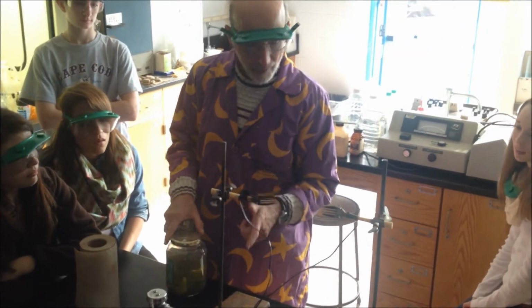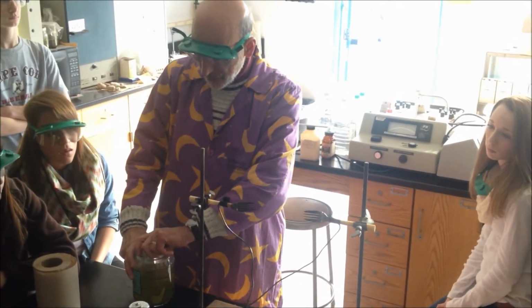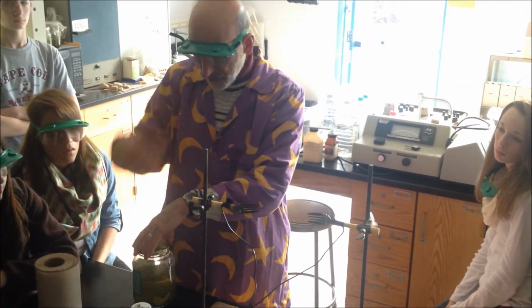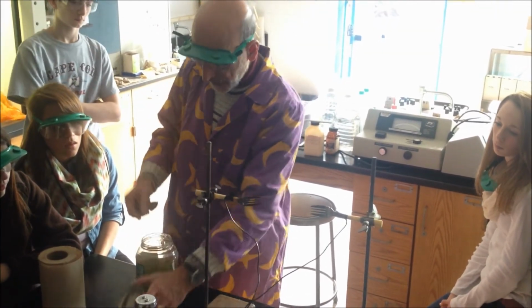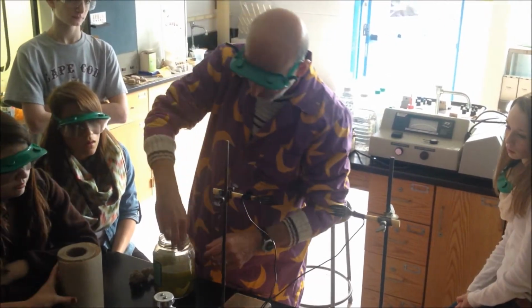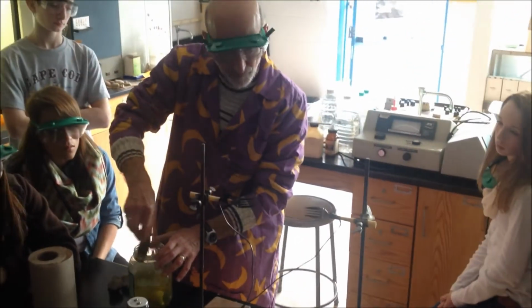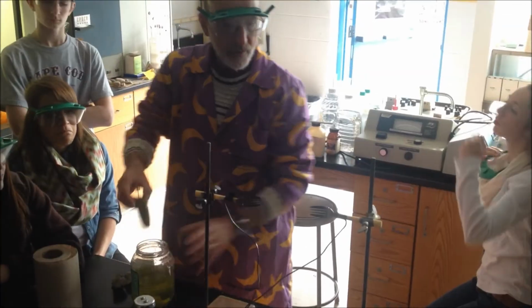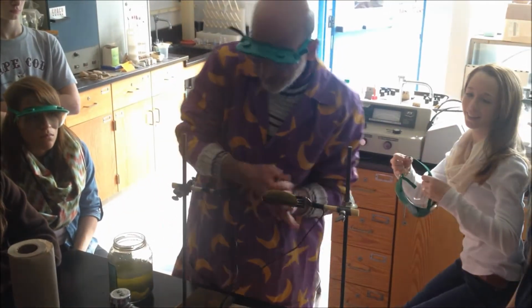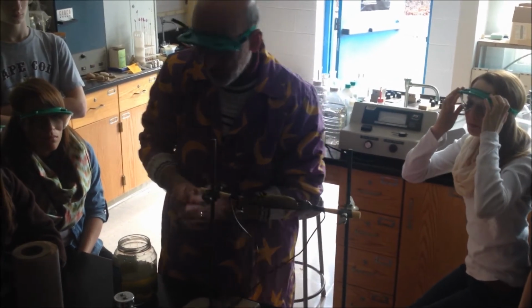Sodium chloride, if I have salt, the characteristic color of sodium is yellow. Like if I took a little salt, put it in a flame, it would glow yellow, just like that potassium stuff glows violet. So what I'm going to do is energize this, but I'm not going to use the flame. I'm going to use electricity. I'm gonna shock a pickle. And you'll see why I do this last. Can you do it to a jalapeno? Anything salty, yeah. It's so cool. Stab it. Smell it. It's going to smell worse. That's why I do it last.